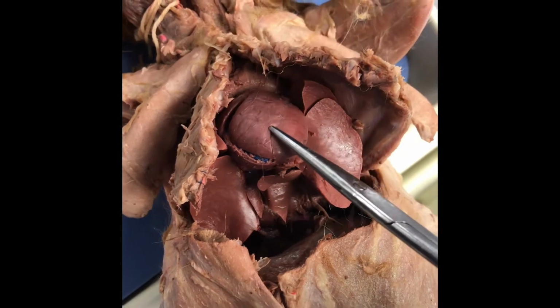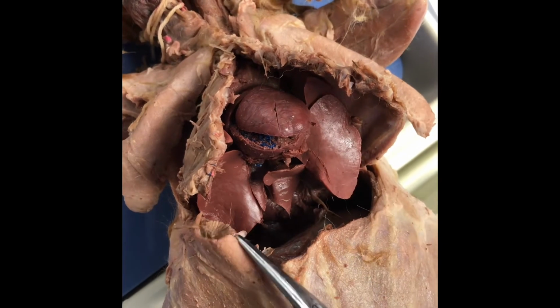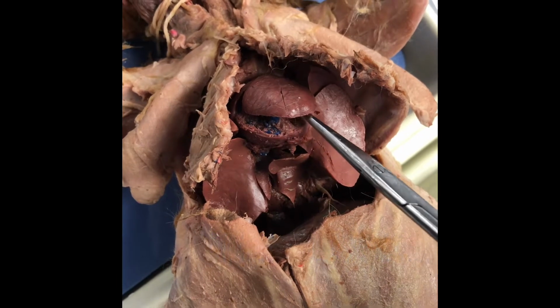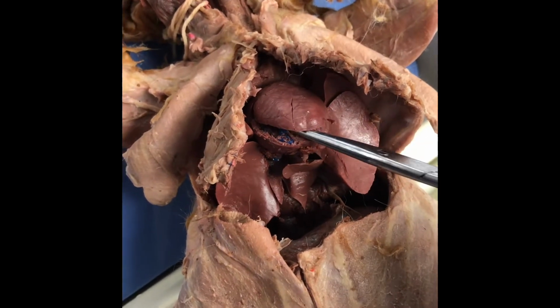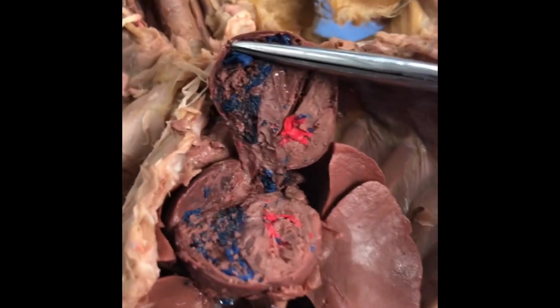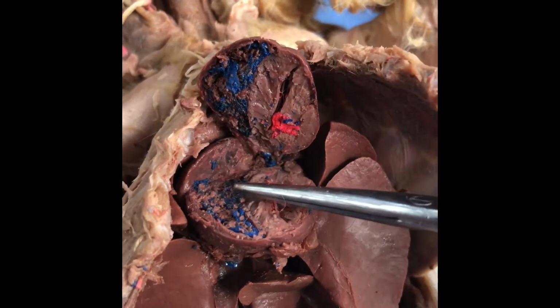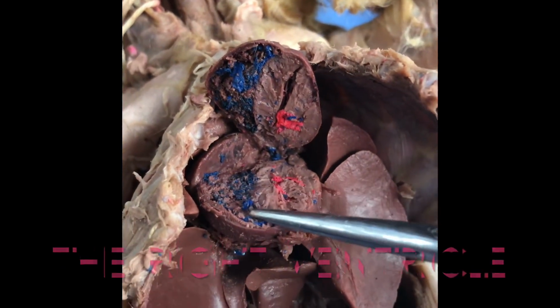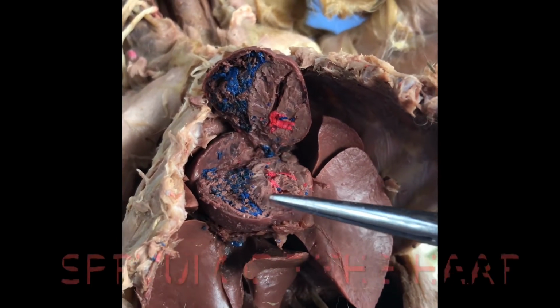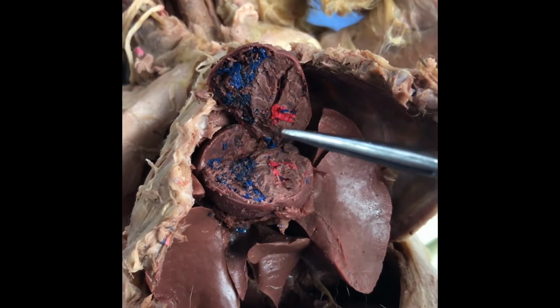So here we are opening up the chest. We already had it open to look at the lungs. This is the heart. Here are the lungs on both sides. And then what we did is we cut the heart open kind of Pac-Man style around the apex so we could lift it up and then see the dye inside. So on the right-hand side, you have the deoxygenated blood, and it's in the ventricles there. And the atrium at the top, and then the oxygenated blood is dyed red, and that is on the left-hand side.